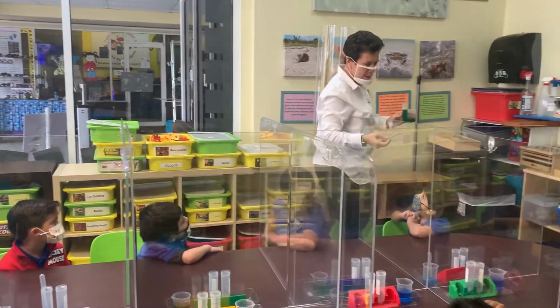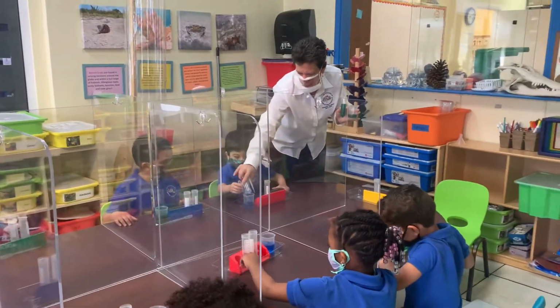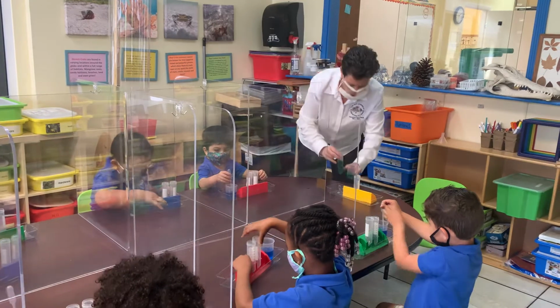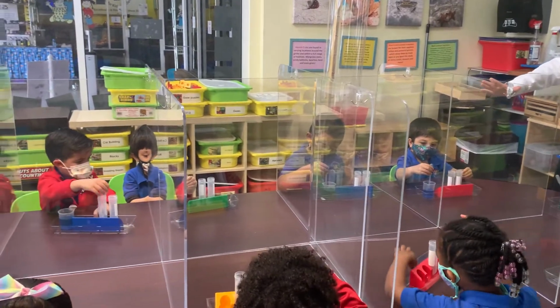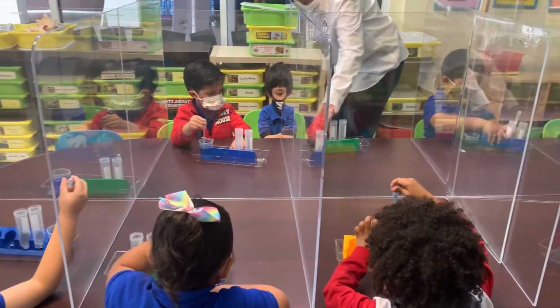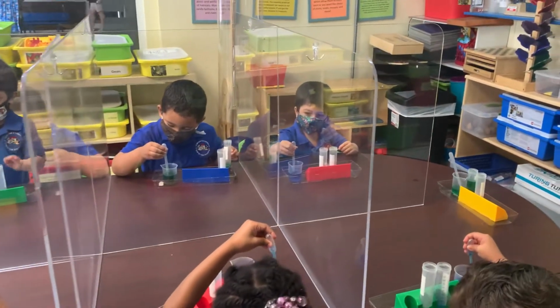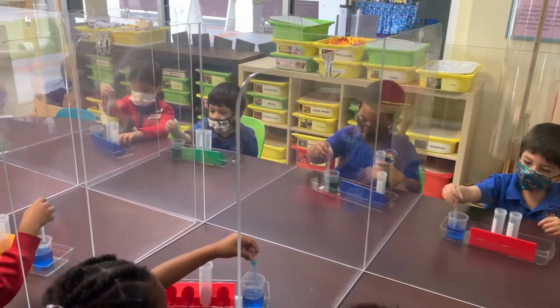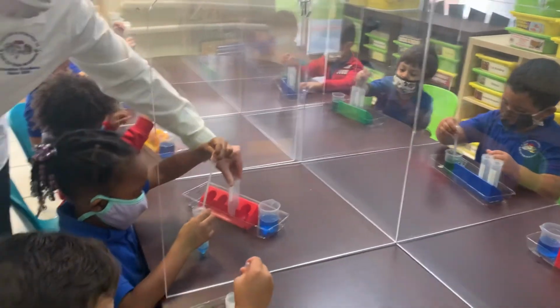Now, I want you to take the tray from in front of you and move it forward, okay? And use your dropper, use your pipette to start getting the water. Remember, squeeze it first, and then put it in the water, and then open it. Good job. And then move it into your test tube. I did it. Squeeze, open, and put it in your test tube. And keep going until you get to 35. The 3 and the 5. So let's keep it in the rack here. Yeah, no, keep it right there. Okay, when you get to the 3 and the 5, then stop.